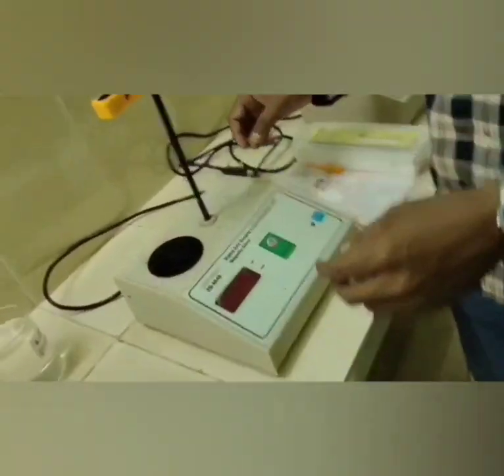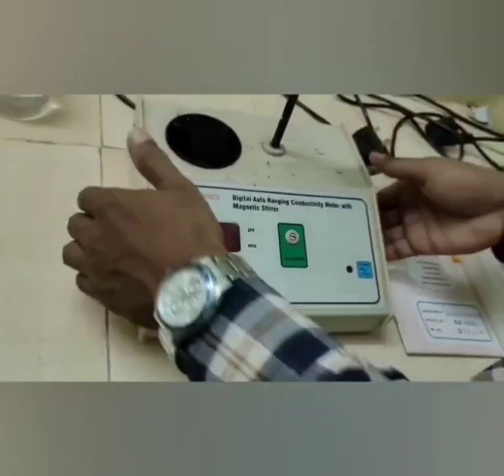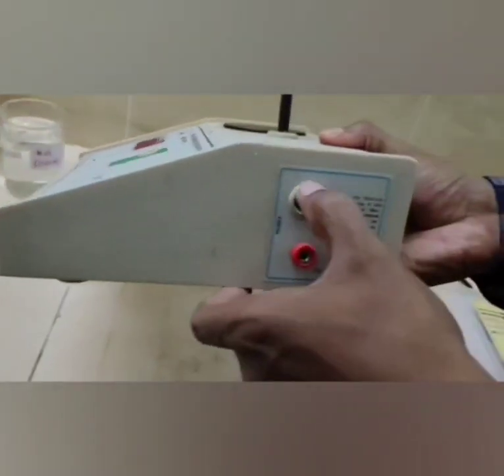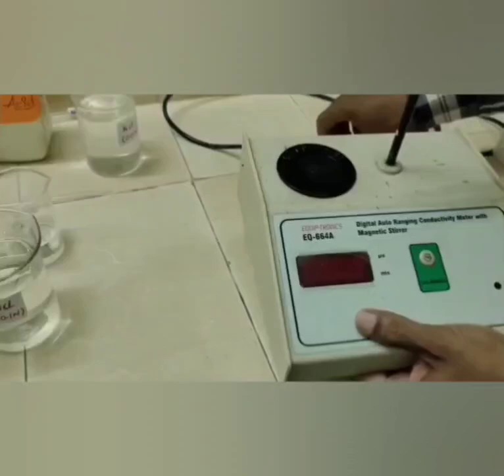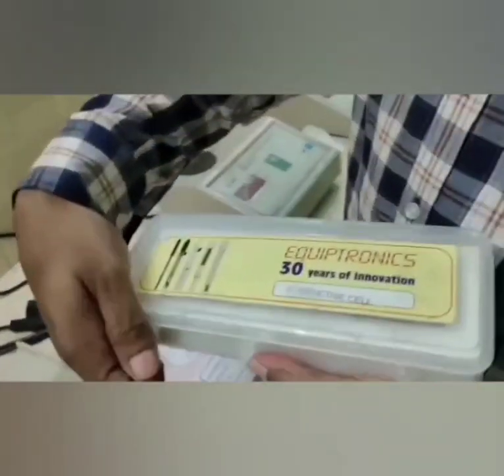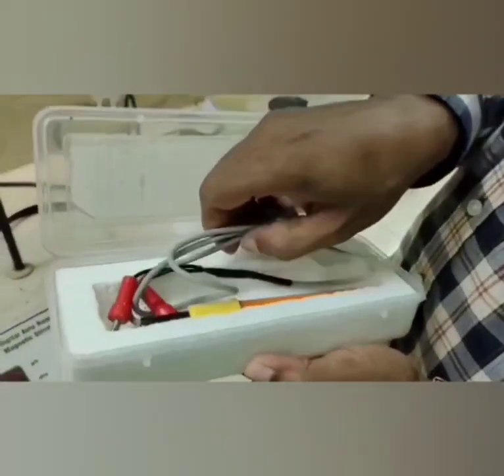The conductivity meter consists of a digital display to read conductance values. At the back side of the conductivity meter, we have an on and off switch. On the right side of the conductivity meter, there is a standard conductance switch. In this box, we have a conductivity cell.